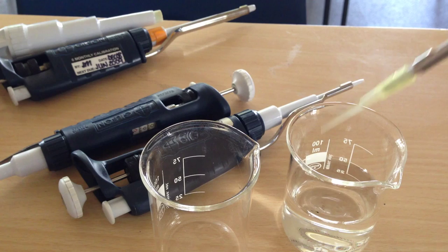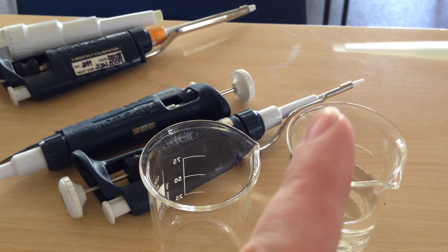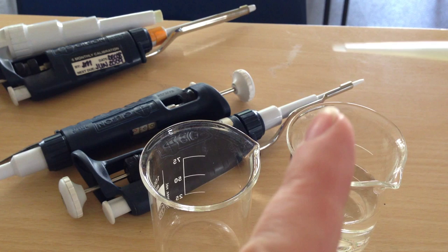Suck it up, and then I'm going to get rid of the water there. And you'll see here, there is a little bit of water left in this bit here. That is what the second stop is for. So if I push it to the second stop, you'll see that drop of water comes out.